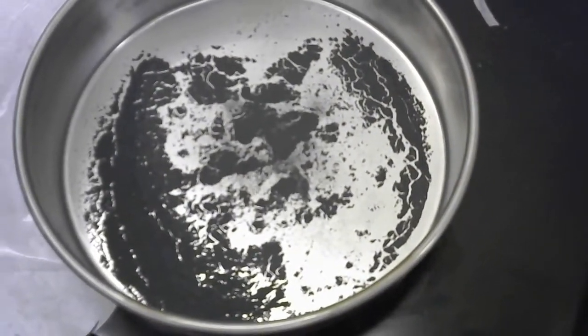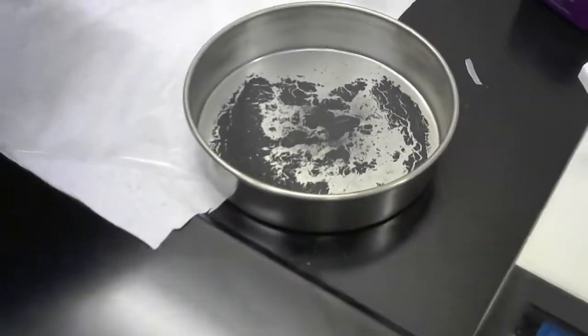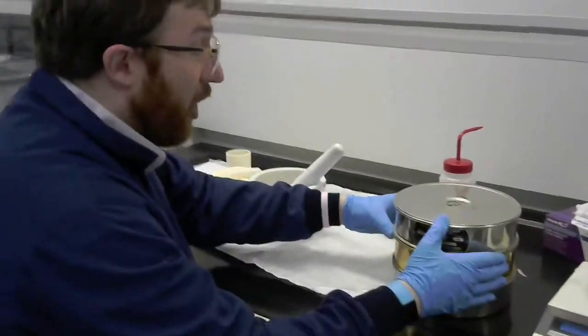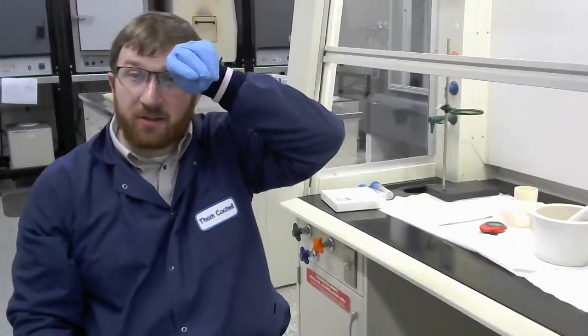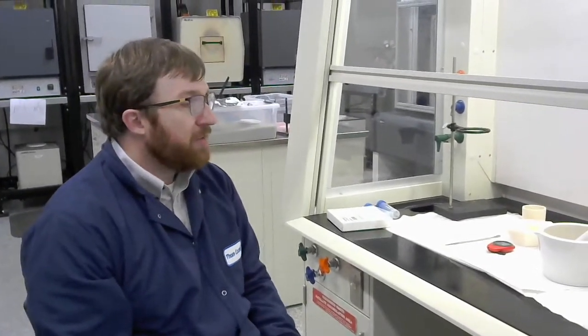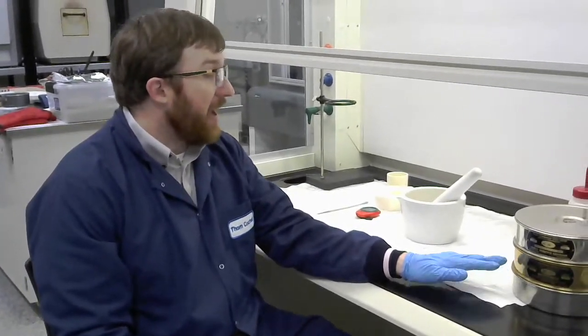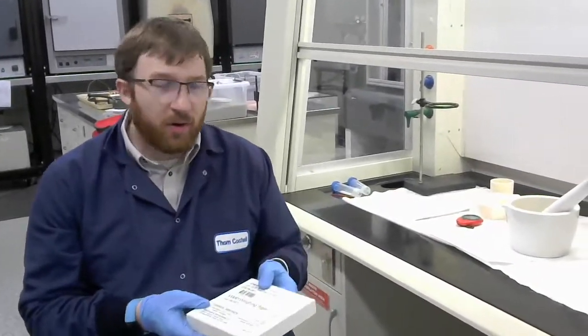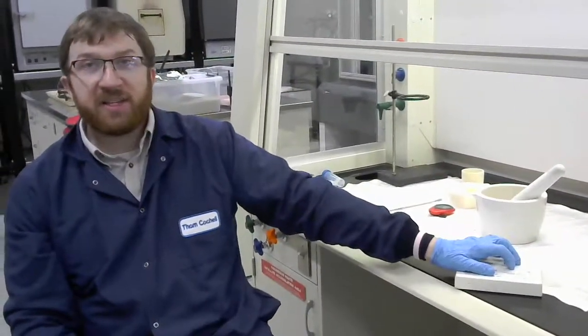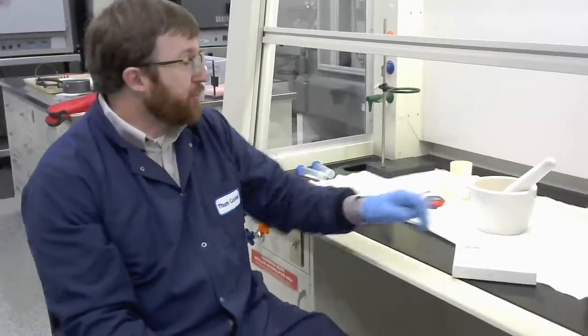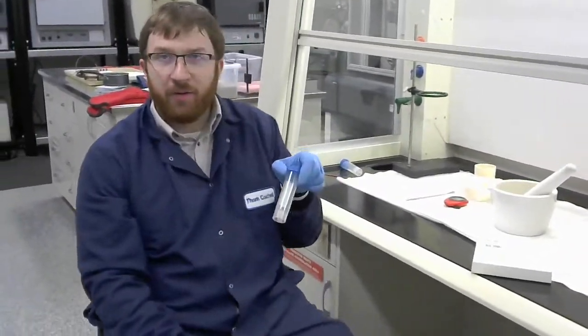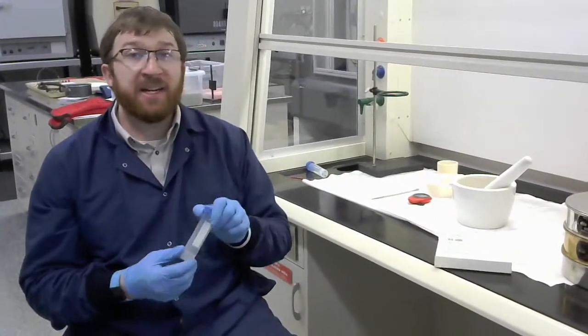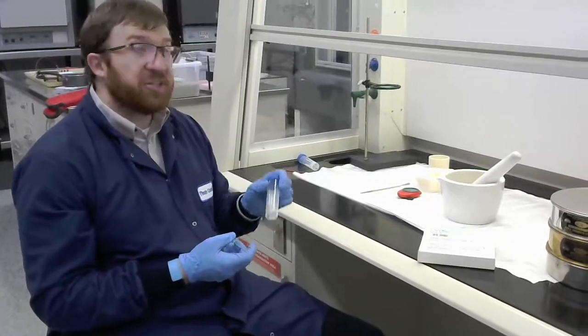Alright. So some of it made it through, not a huge portion, but enough. So this is a finer powder. So this is all the powder that's made it through this condition. So that's ready to go. I don't have to do anything with that at this point. So what I'm going to basically do with that powder, anything that makes it through, I can take that out. So just to be careful, what I'll do is I'll use those big weigh papers that we've used before. I'll take all the stuff from that bottom pan, put it on the weigh paper, and then transfer it to a vial for storage. So this is what we're going to use in another lab session.